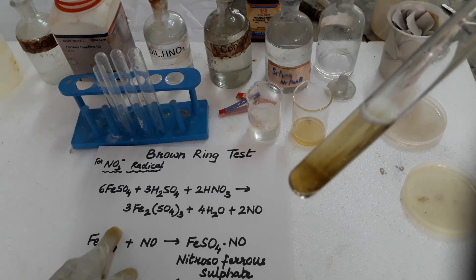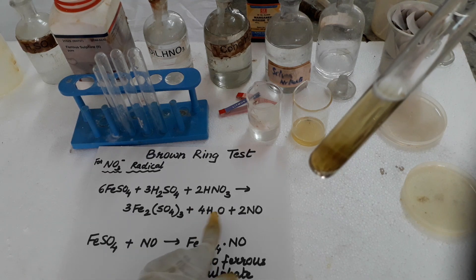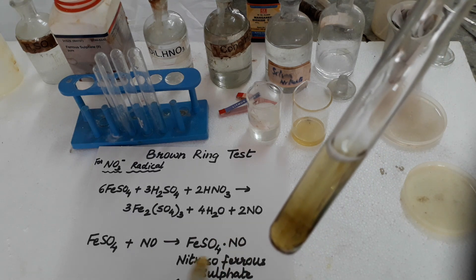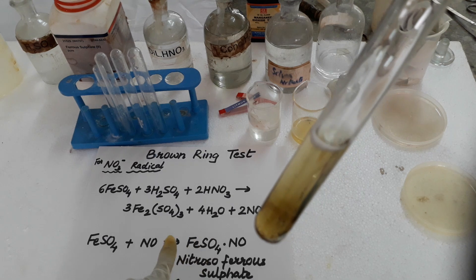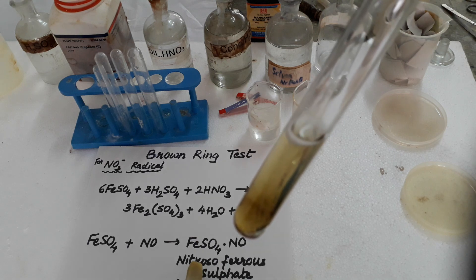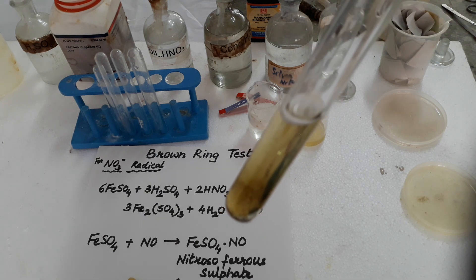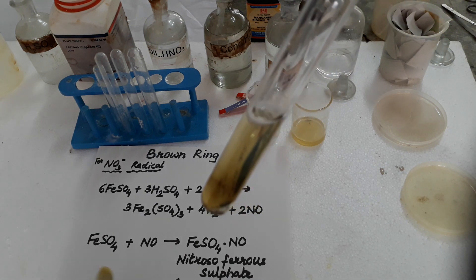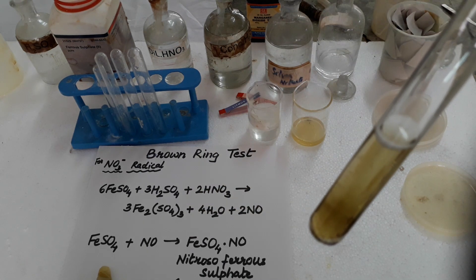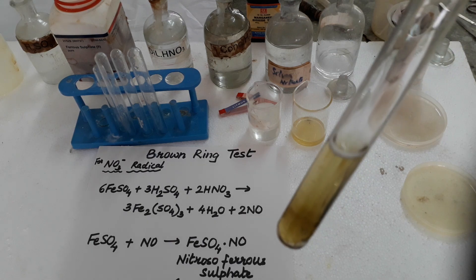What happens — after some time the complete reaction will take place and the final products are ferric sulfate, water, and nitric oxide. This nitrosoferrous sulfate, that is the brown ring, is very unstable. So after some time it disappears, and if we just shake this, kinetic energy increases, molecular motion increases, it will generate heat and the brown ring will disappear. Sulfuric acid will mix with water and the brown ring will disappear. So we do not have to shake this; after some time you will see the final three products are formed and the brown ring will disappear.